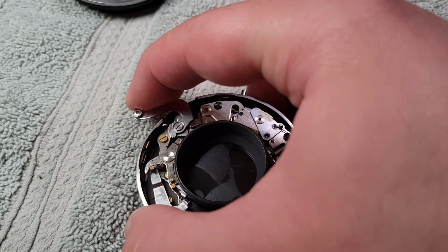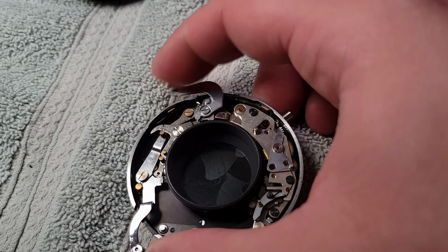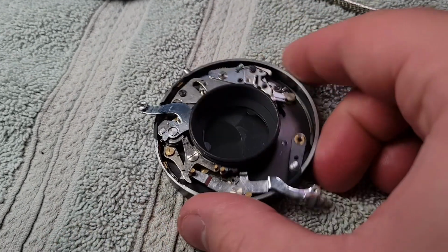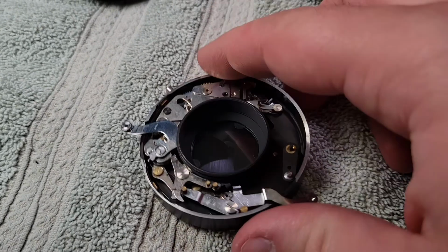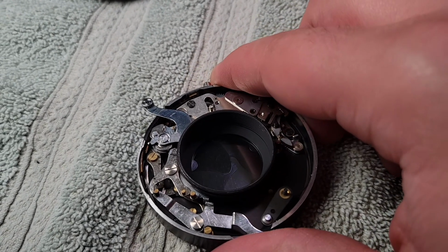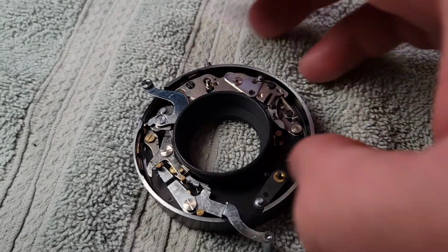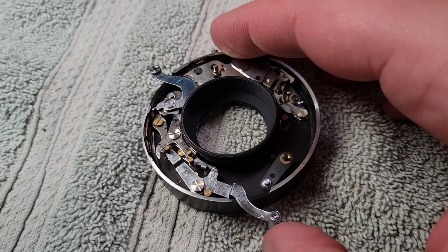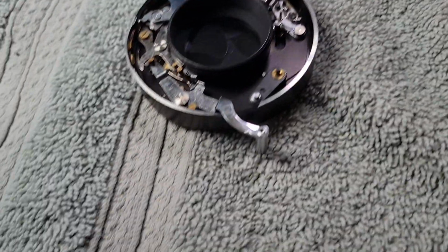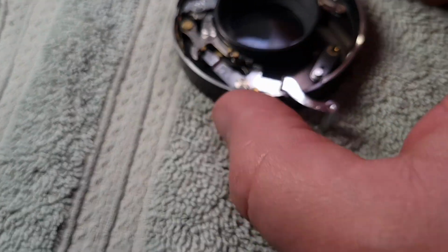So I'm going to try and do this with one hand. And then this is the problem with it, it's just not accurate. It's just not wanting to go. And then if I do it again, chunk. So that's that. I'm going to oil this.